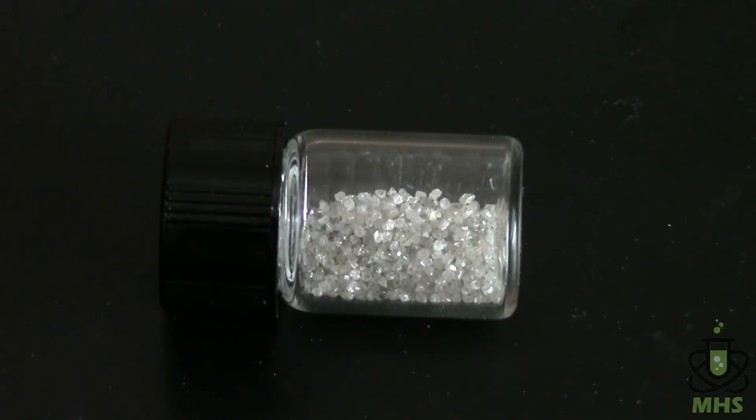So this is an experiment that I think most people wouldn't expect to be possible because diamonds are supposed to be forever and all that. But it actually is. And in fact this is the way that they discovered that diamond is made of carbon by doing the experiment that I'm about to do. So this is kind of a historic recreation.